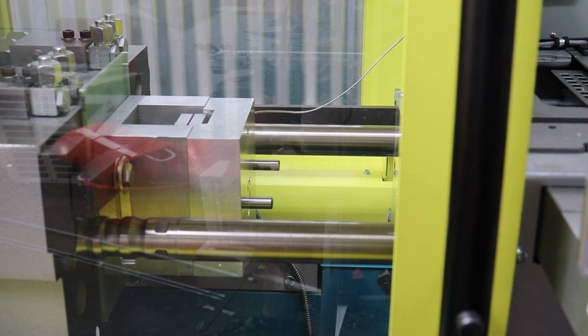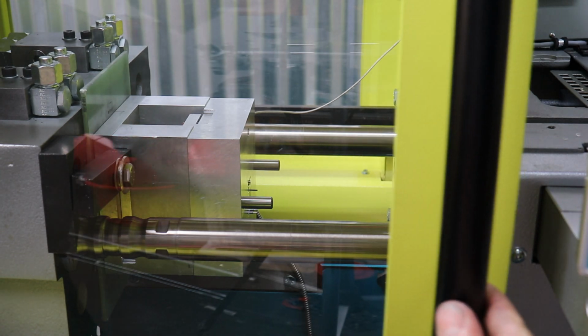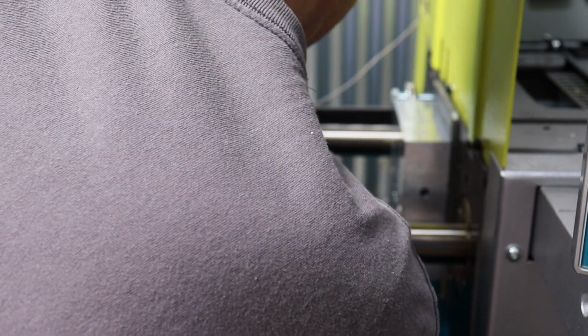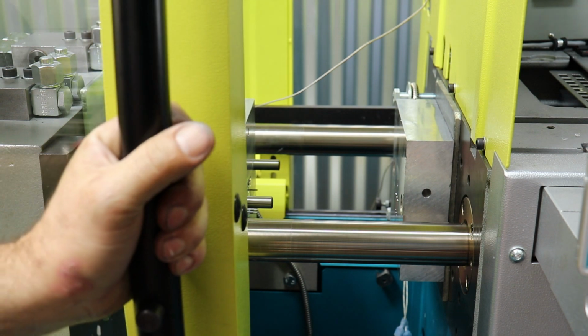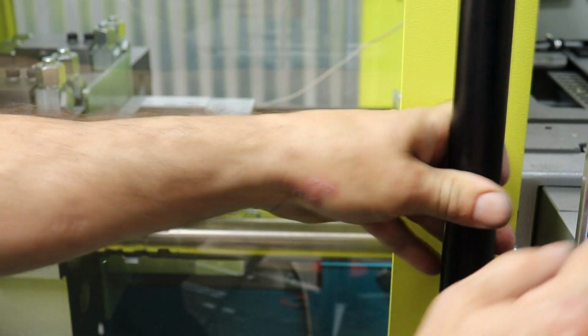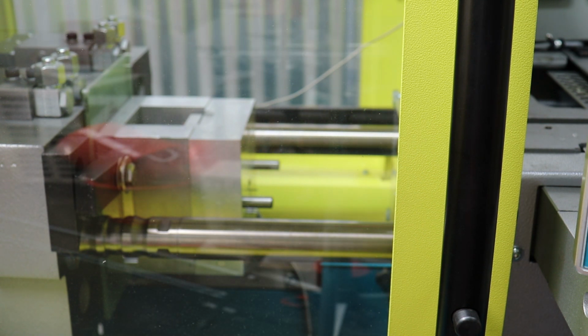Okay, I'm gonna hit manual and eject forward. I don't even think I can get a file in there right now. All right, so I'll stop the pump. Let me see what I can do. I'm gonna take some of the grab off of this thing. Of course, when you do this, you gotta clean all your little metal particles out, so running several more parts will do that too. Okay, I'll turn the pump back on now that my hands are out of there. And let's try another shot.